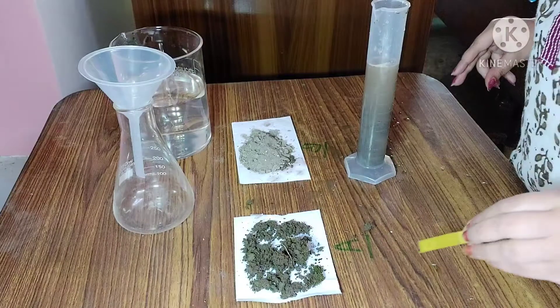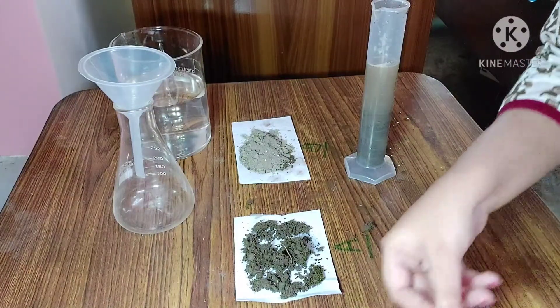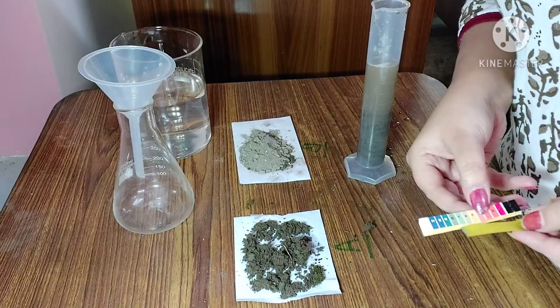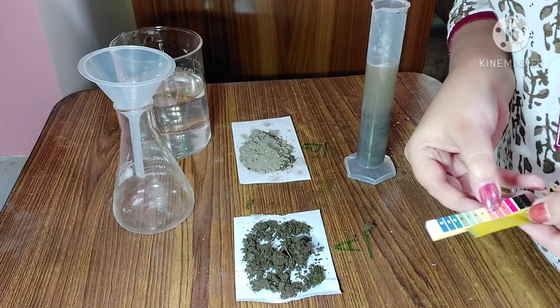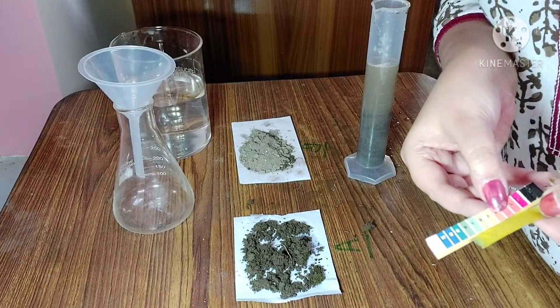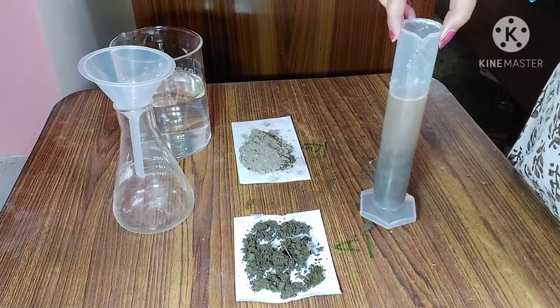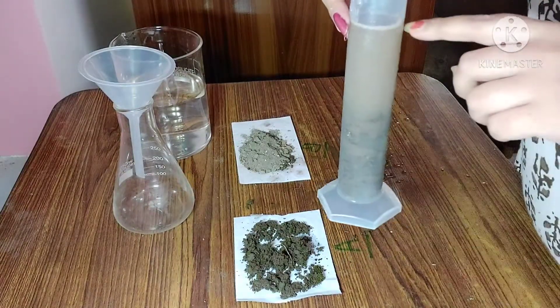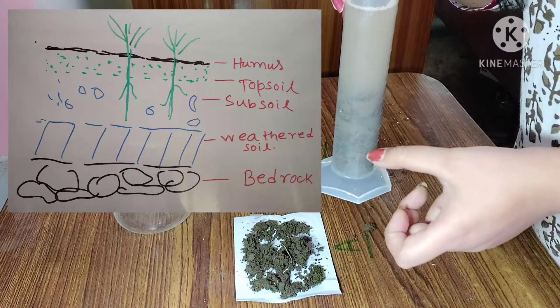Let it dry for a few minutes. Then match the color with the pH paper chart — you can see the pH is around 8. After settlement, you can find that in the upper portion, humus has accumulated and fine layers are visible.